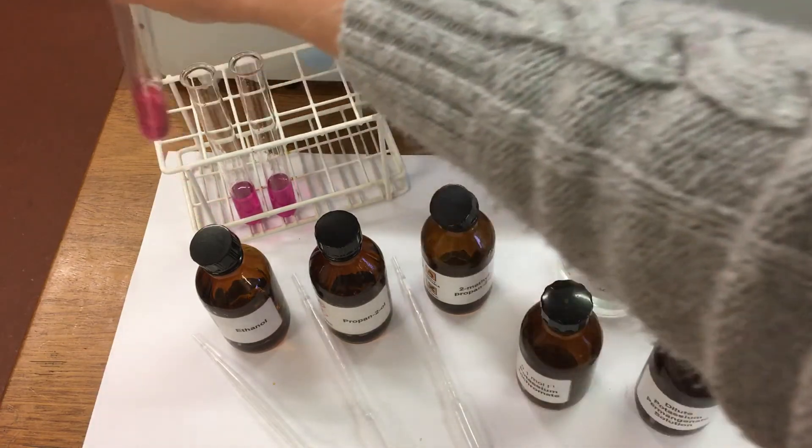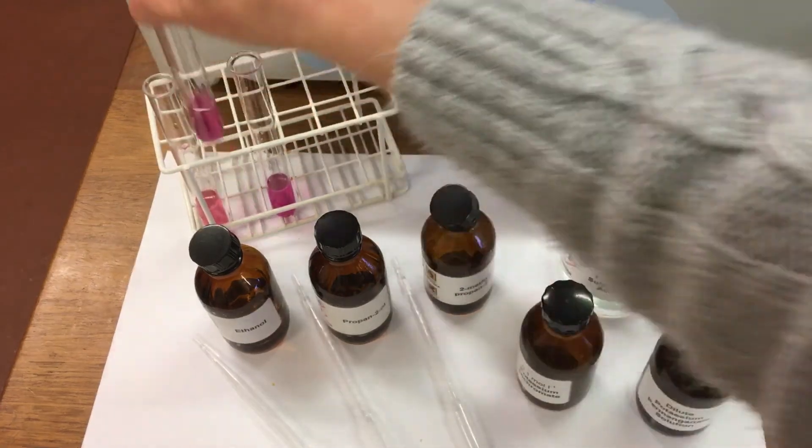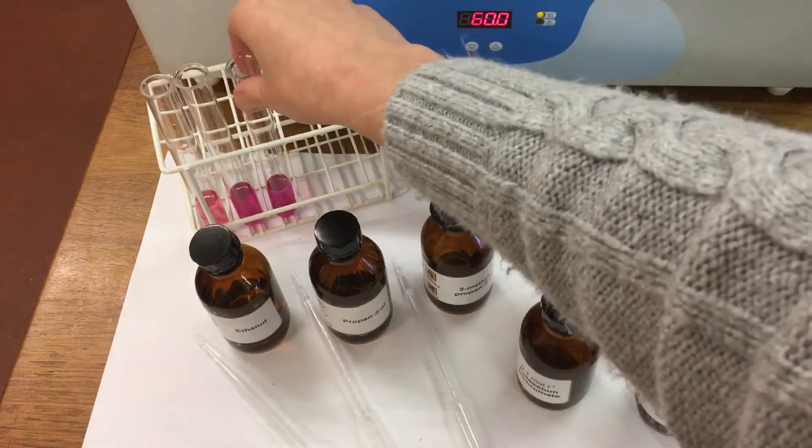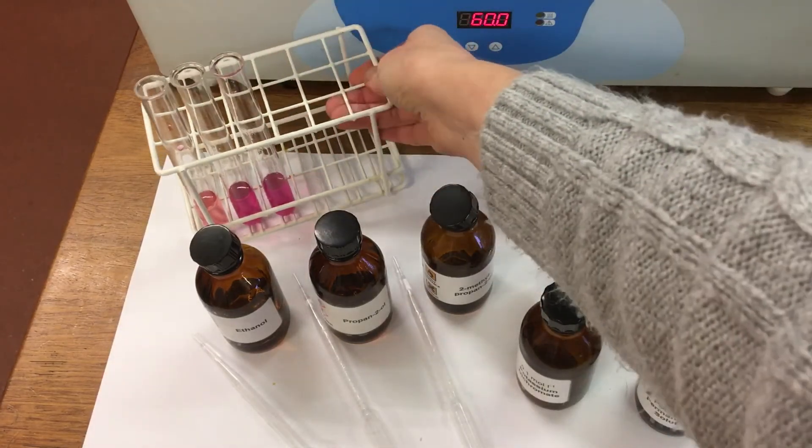I'm going to mix each test tube, and these will again go in the water bath for a couple of minutes.